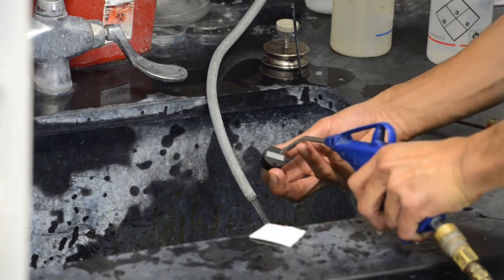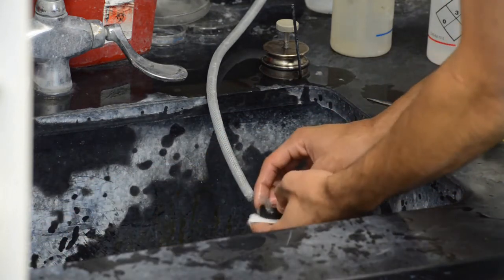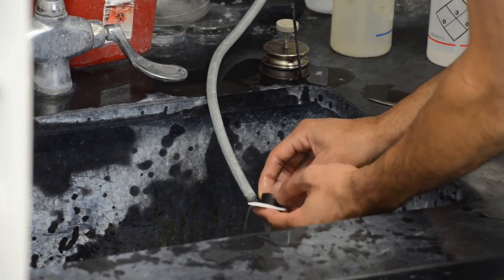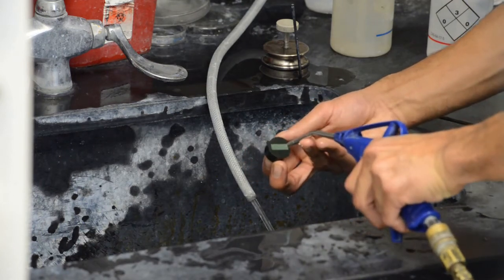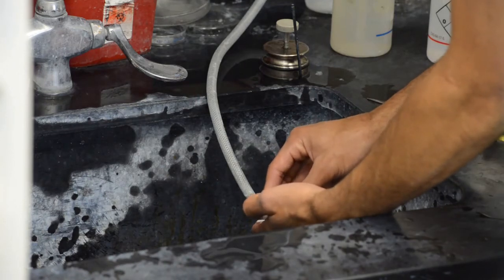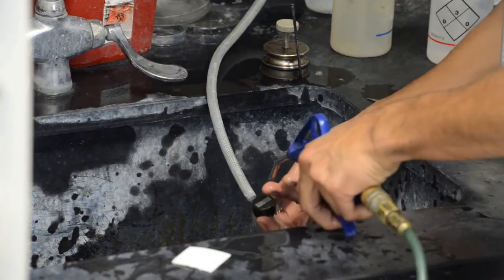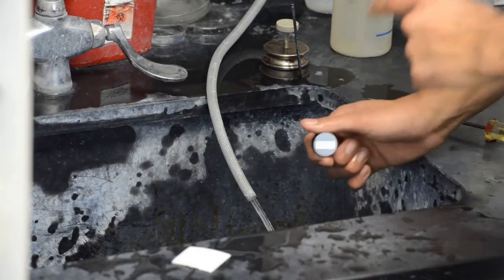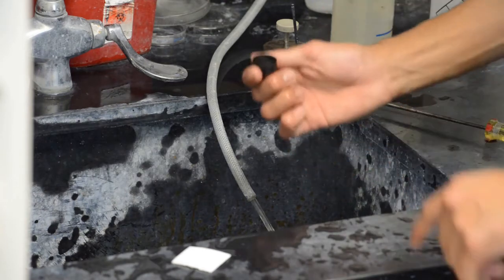And you blow this out. Sometimes you have to do this numerous times. I usually do it four times. All right. Blow it out. Again. Blow it out.